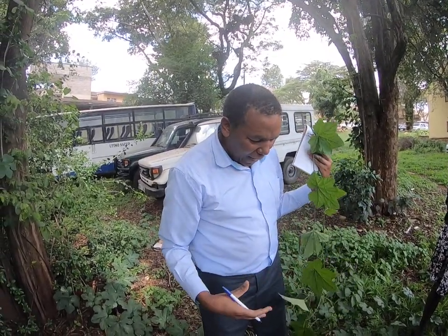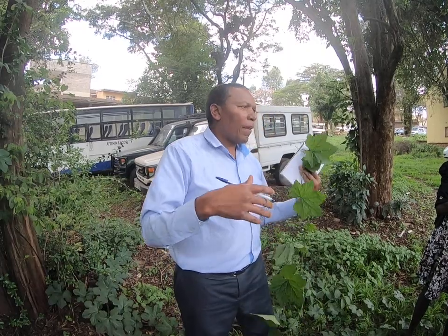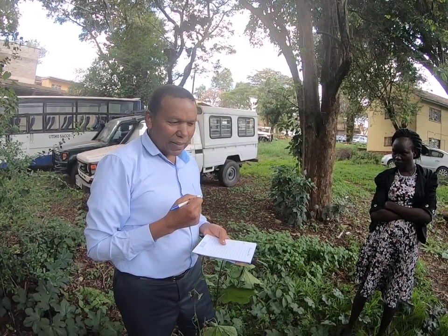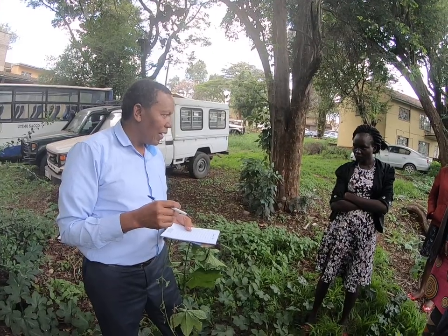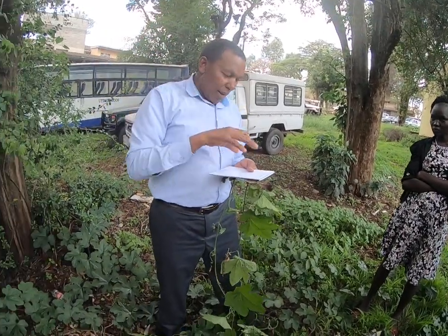And if it has fruits and flowers, you can also describe the flowers or the fruits. The flowers, the petals are red, and the flowers are small, tiny, star-shaped or whatever. You can write as much as possible. That is description. You have described the plant as you see it in the field. You can also describe the environment. Is it under a tree or outside the tree? Is it in an open place or in a shaded area? So the ecology is important. So the description of the plant, and then the ecology follows.